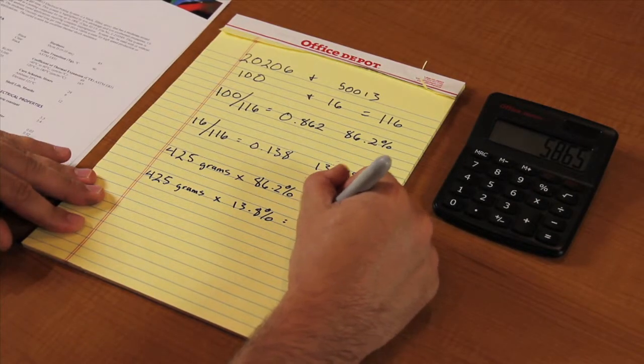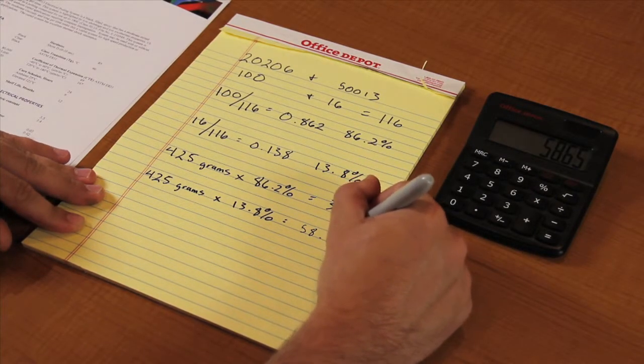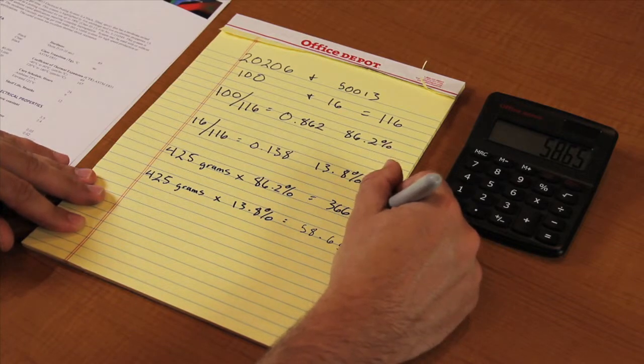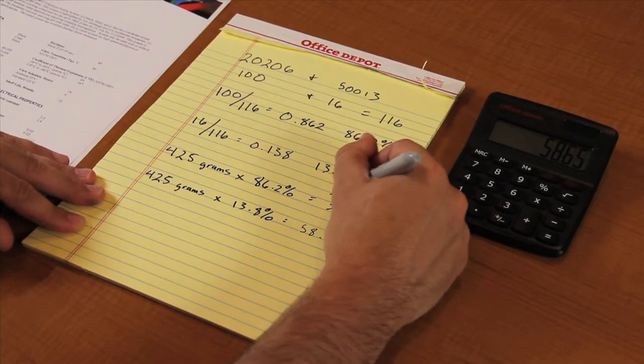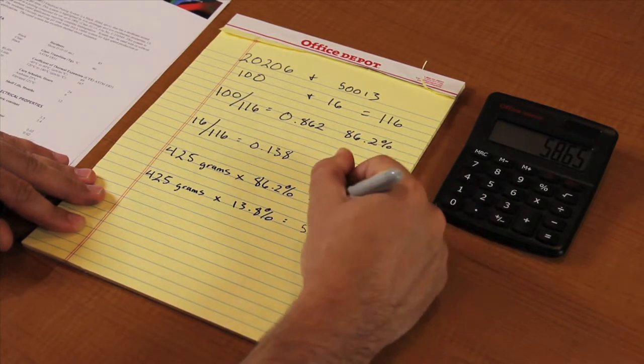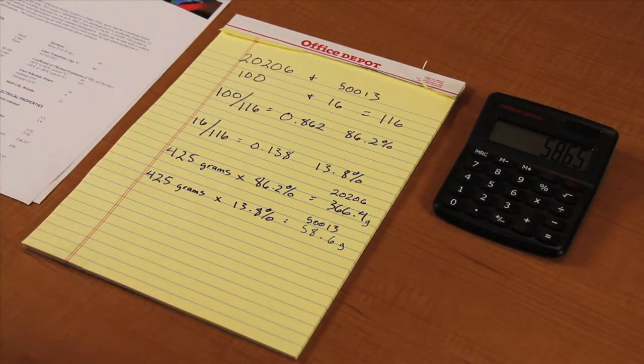It is important to remember when you are measuring this material that you stay within plus or minus 5% of the calculated ratio.